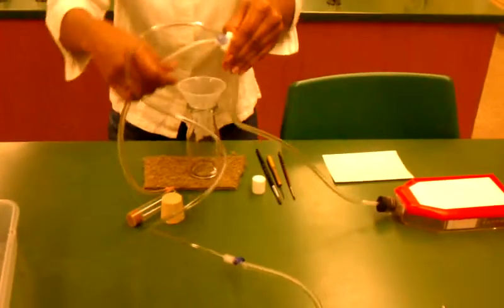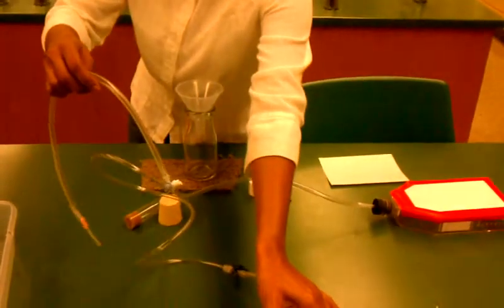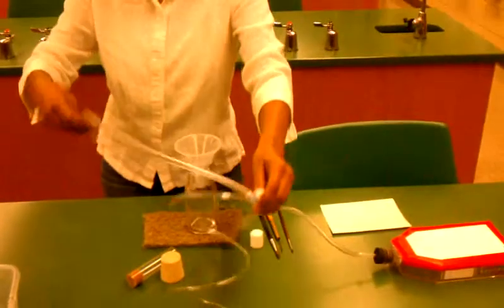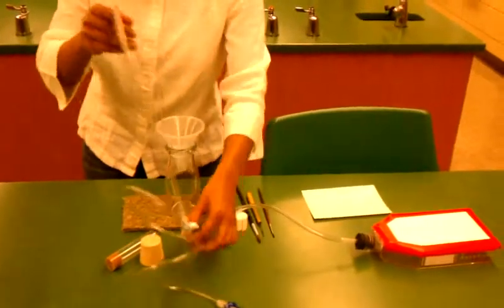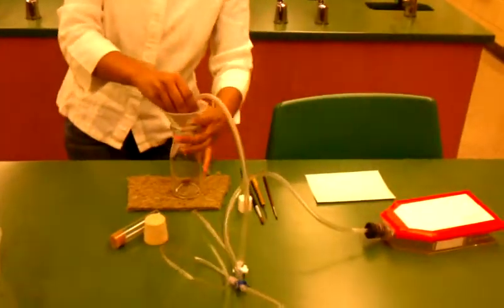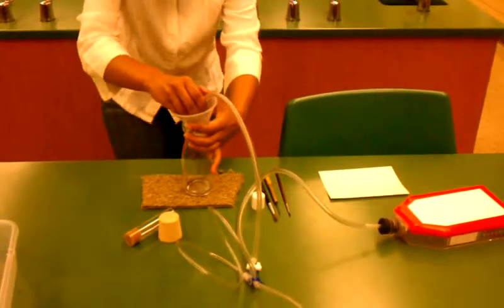Adjust the spigot on the CO2 so that the valve is pointing away from the needle. Unfortunately, they do devise these things so that it's pointing opposite the direction you want.